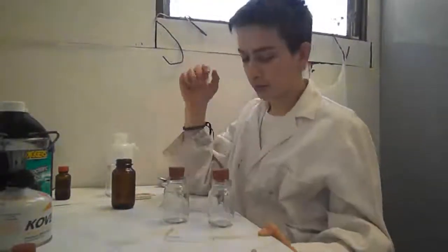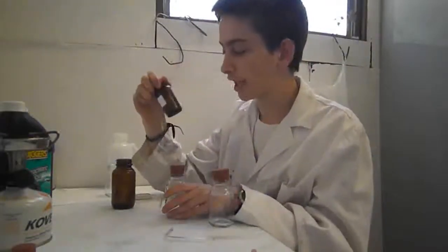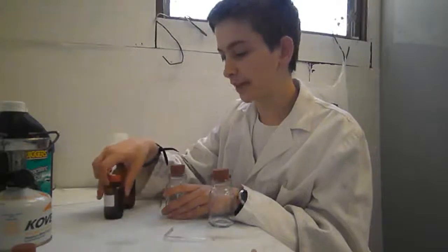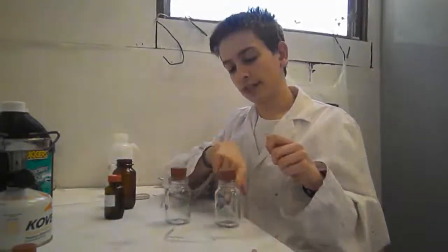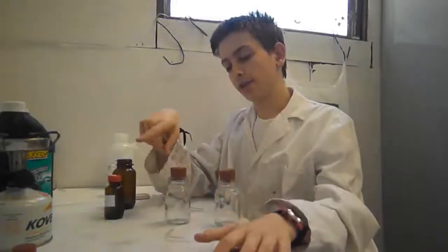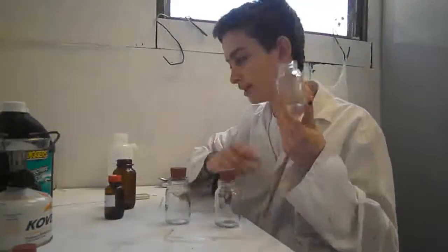So what I'll do from then is I'll grab some zinc, which I got out of one of those heavy-duty carbon batteries. It's pretty badly corroded, but hopefully it'll do the job for now. I'll put the hydrochloric acid in there, zinc in there, have a tube running down here, connect them up with my rubber tubing, and through the other end, I'll use some more rubber tubing to lead into a little tub of water. Now in that water, I'll have another one of these bottles.